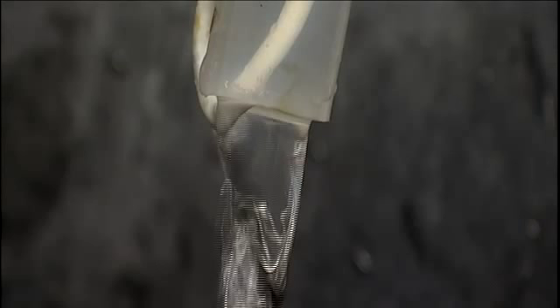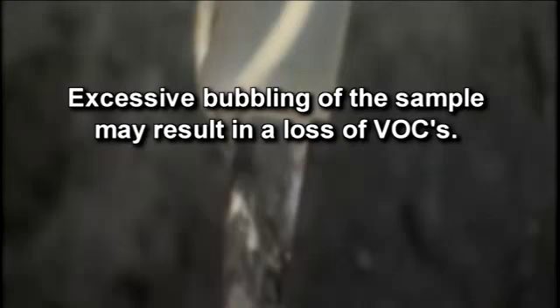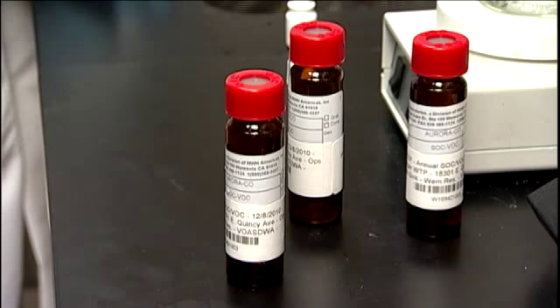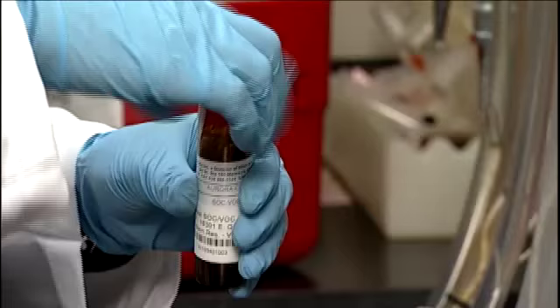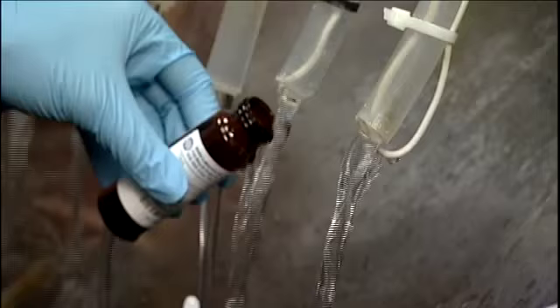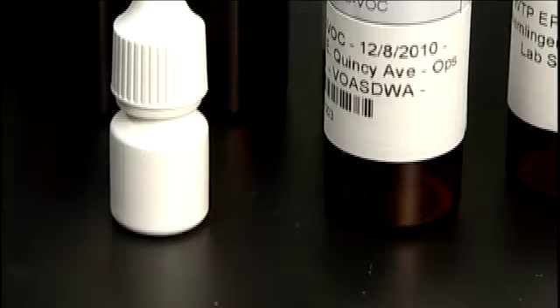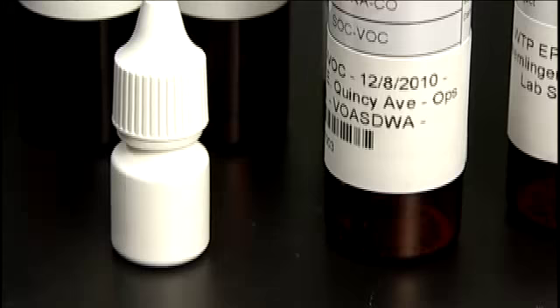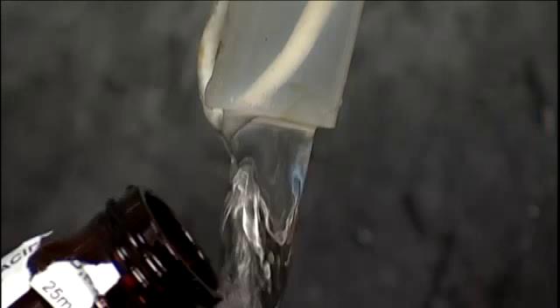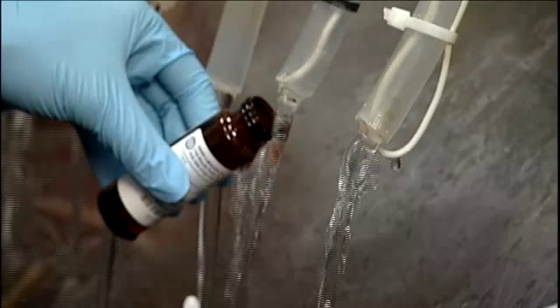Next, adjust the flow so the bottle may be filled without splashing or aerating the sample. Excessive bubbling may result in the loss of VOCs. Do not adjust the flow while filling. Be careful not to set the cap down or contaminate the inside of the cap or vial — hold the cap by the outside, down and away from the sampling site. Tip the vial slightly and place it under the stream of water so the water flows down the inside wall. If the container contains a preservative, be careful not to rinse it out or overfill the bottle enough to significantly dilute any preservatives.